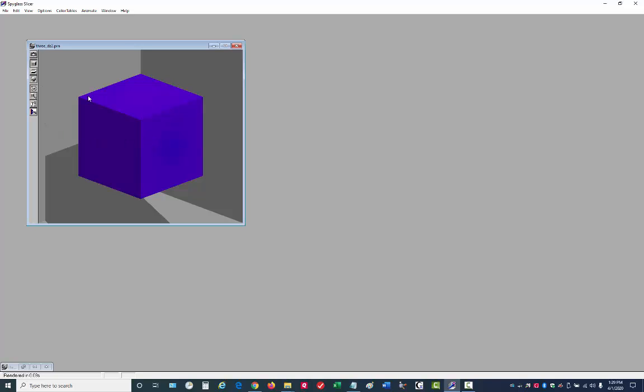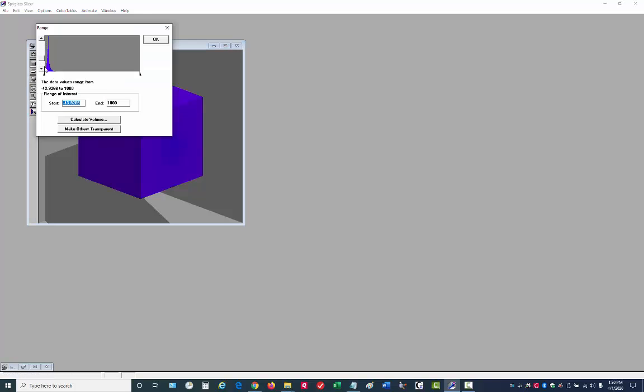It's much easier to work with Slicer if auto render is turned on. The next thing before you do anything else is you should look at the range of your data. Under view, choose range. This gives you a histogram of your data. You can scroll up here and manipulate the y-axis. As you can see, in this case, all of our data is clustered down at one range of the color map. So we're not going to be using very many colors here to show our data. It would be better if our data were spread out over the full color map.